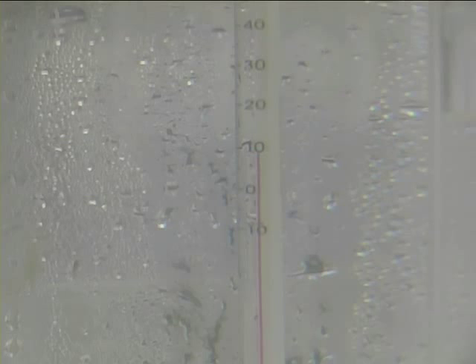The temperature of the system is then raised and the procedure repeated until such time as you lose control of the level in the capillary or atmospheric pressure is reached.